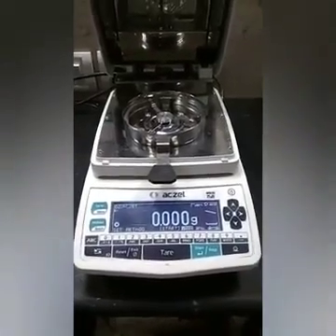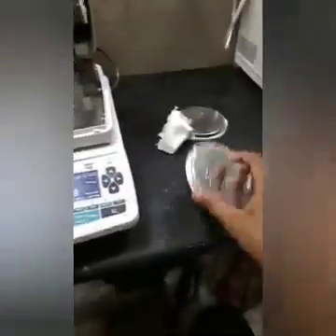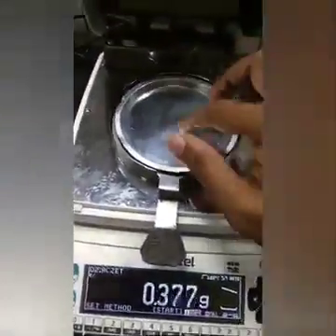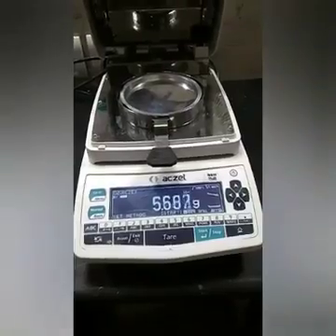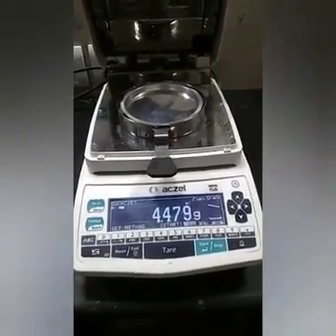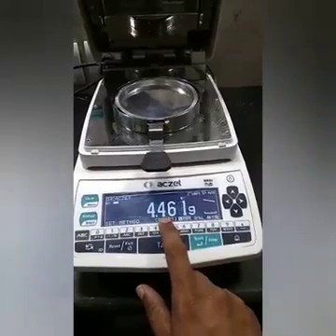In this video I will show you how to analyze the moisture from this machine. First of all, there is one dish — put this dish on the balance at the center. It will show the weight of this dish. Now just follow the key here, what is written there.